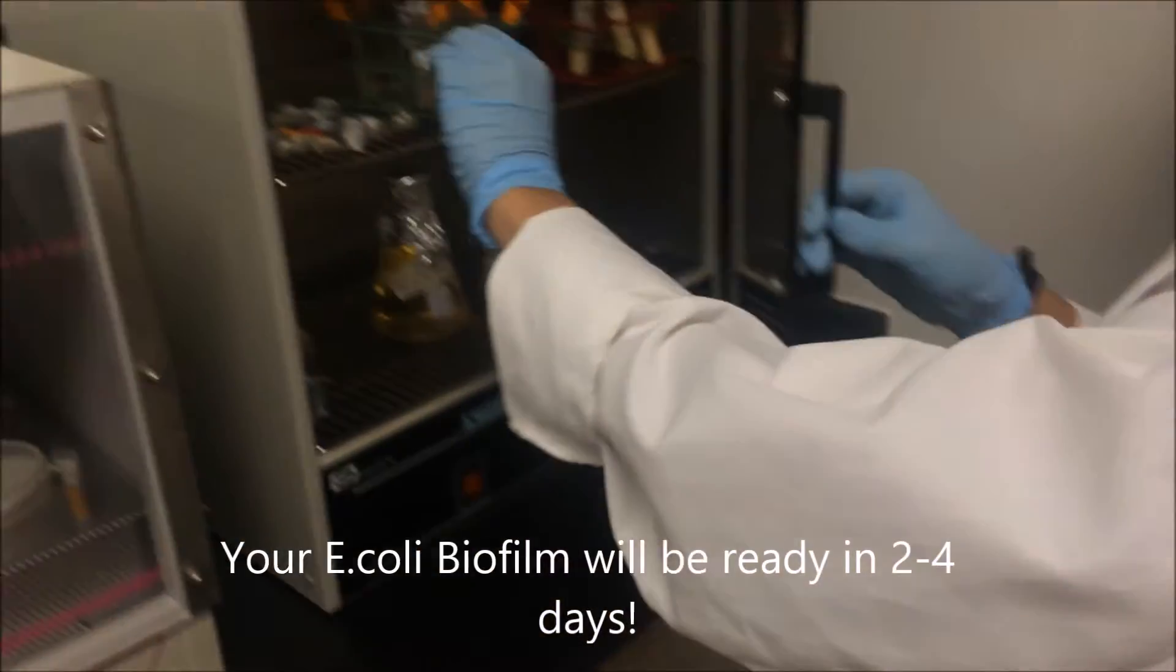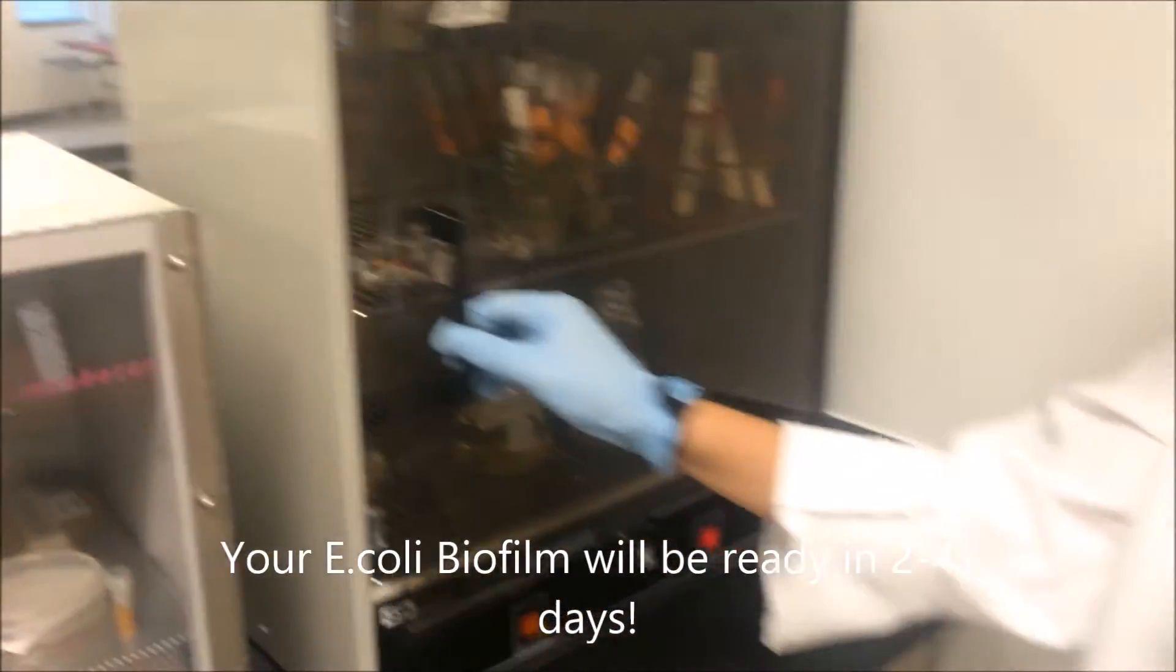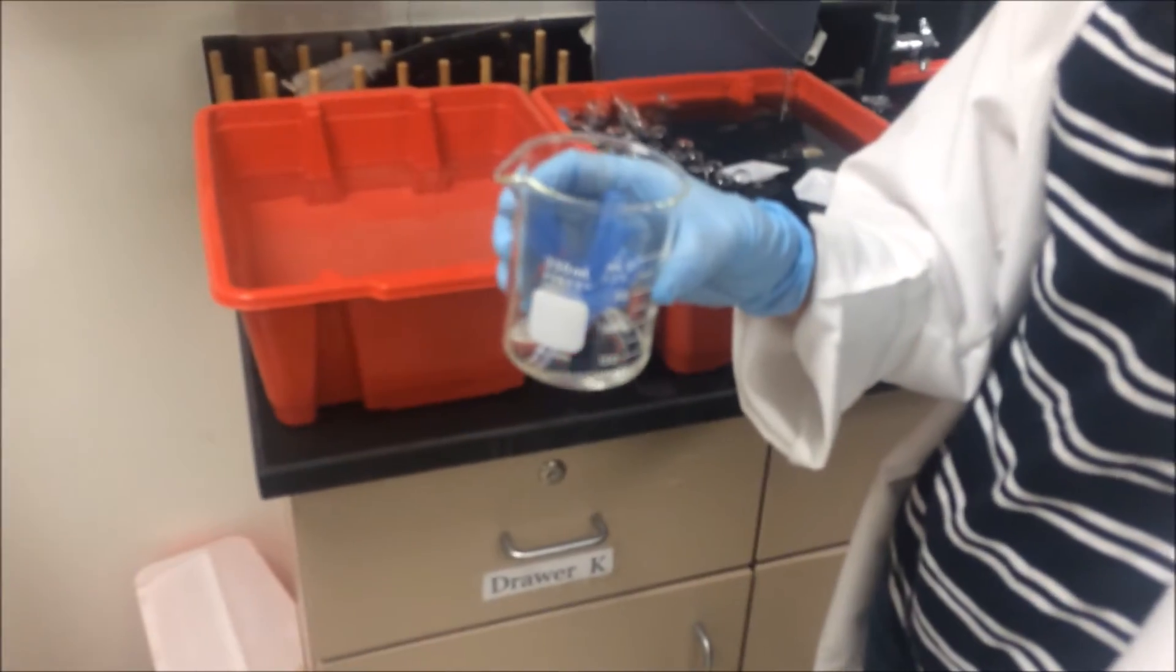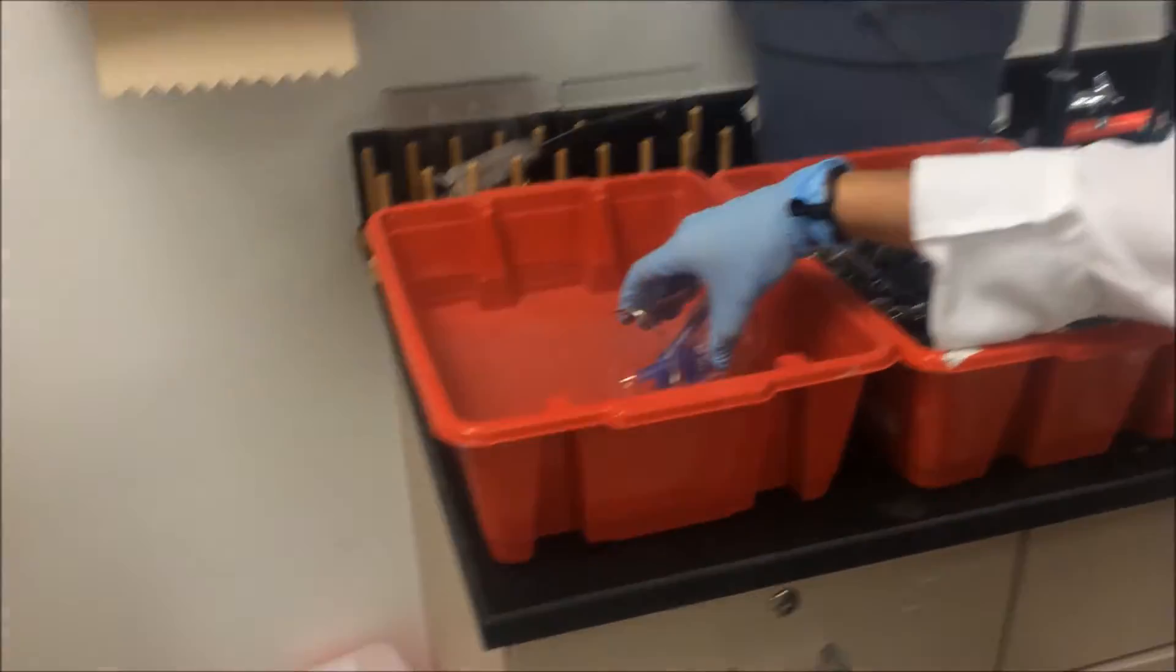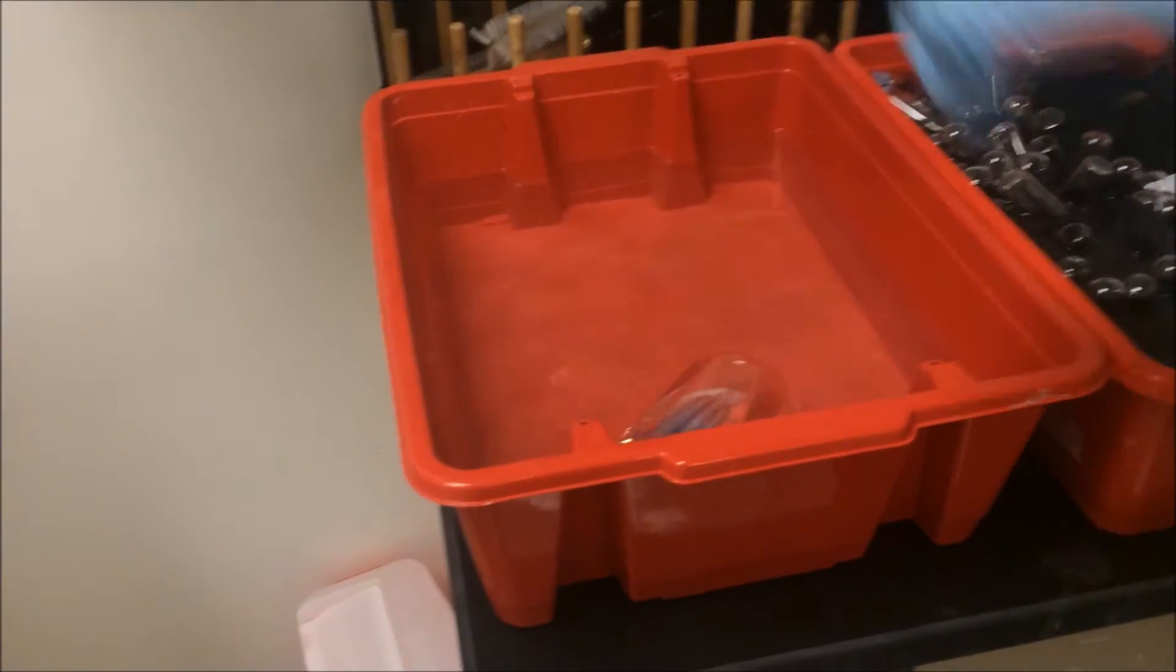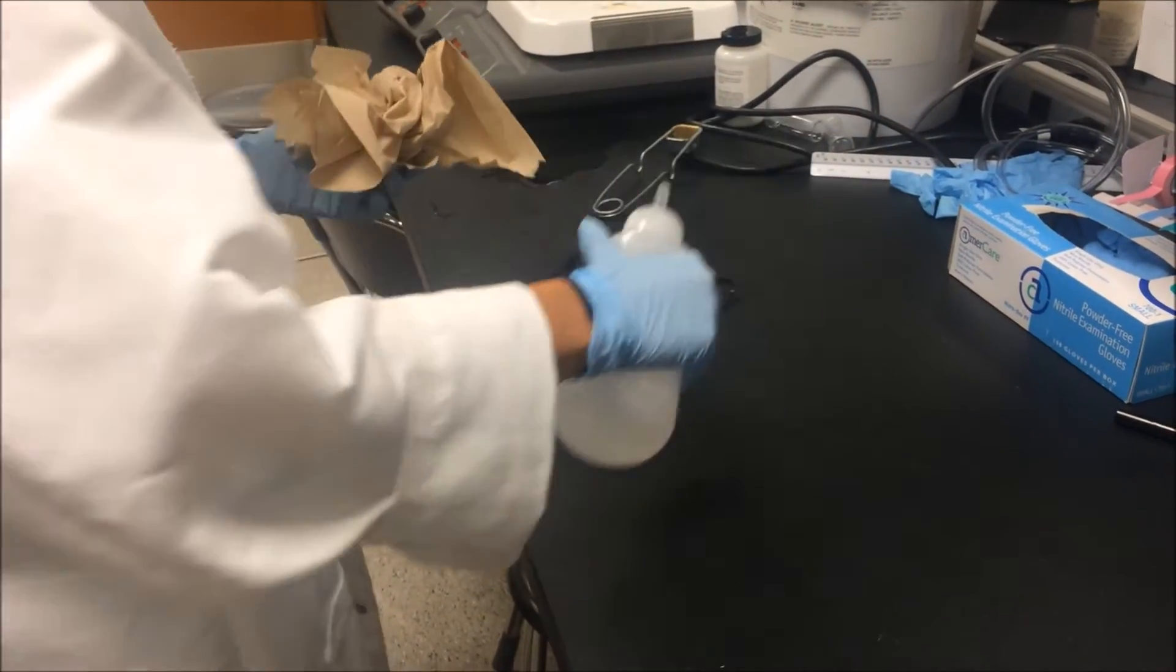Place in incubator. Put contaminated items in biohazard waste. Spray off table with 70% ethanol to kill any bacteria.